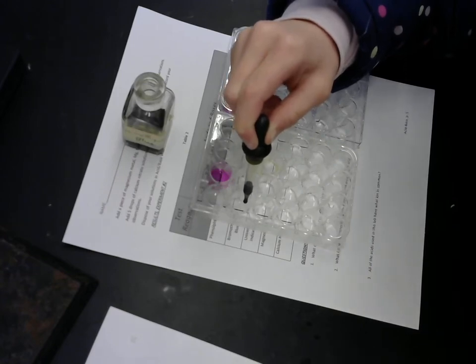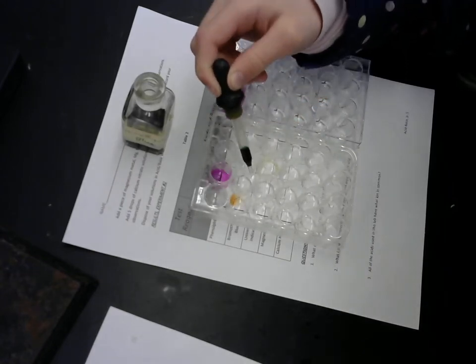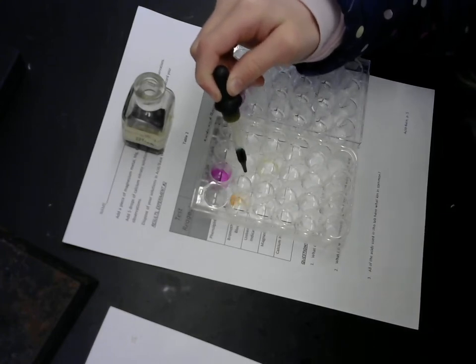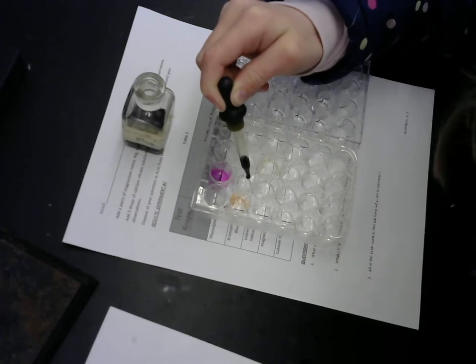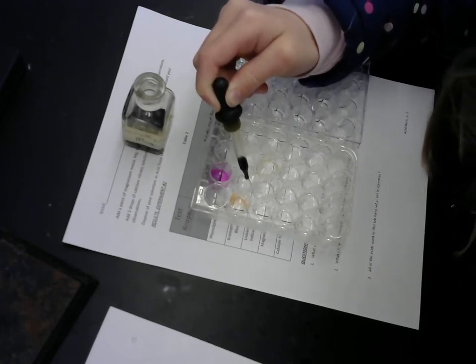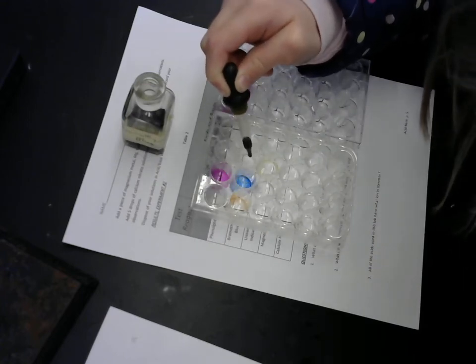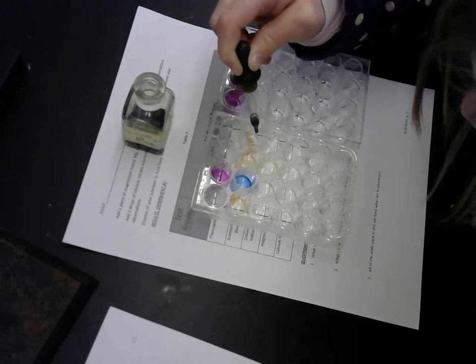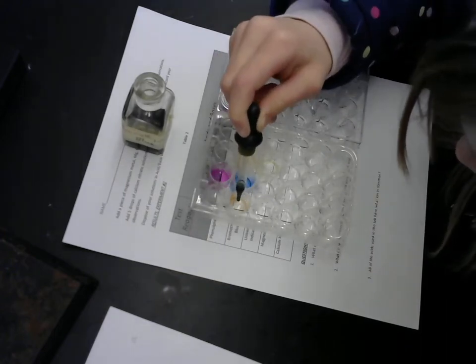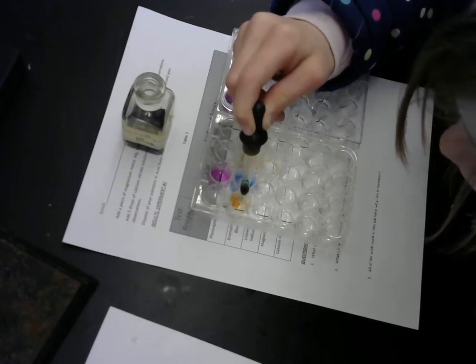Just one drop will be fine. I know, but it's a big drop and it won't go. That's not blue. Go drop. Oh, that one's blue. Why don't you put a couple drops? Oh, okay. Sorry, it's not quite as dark as I was hoping it would be.